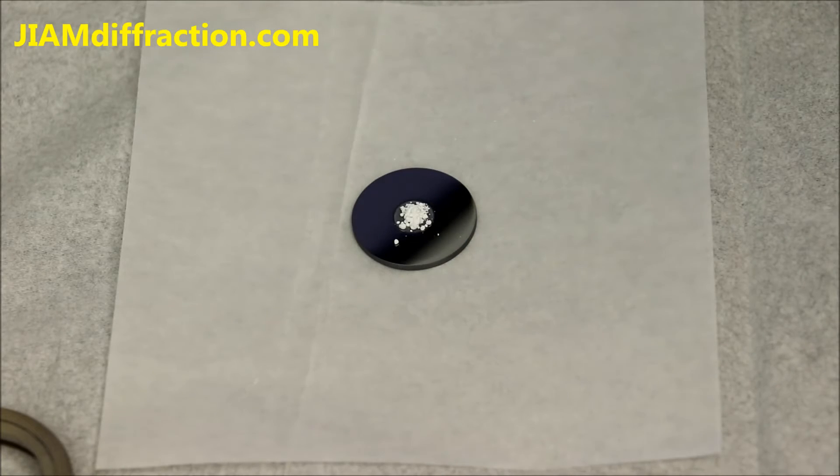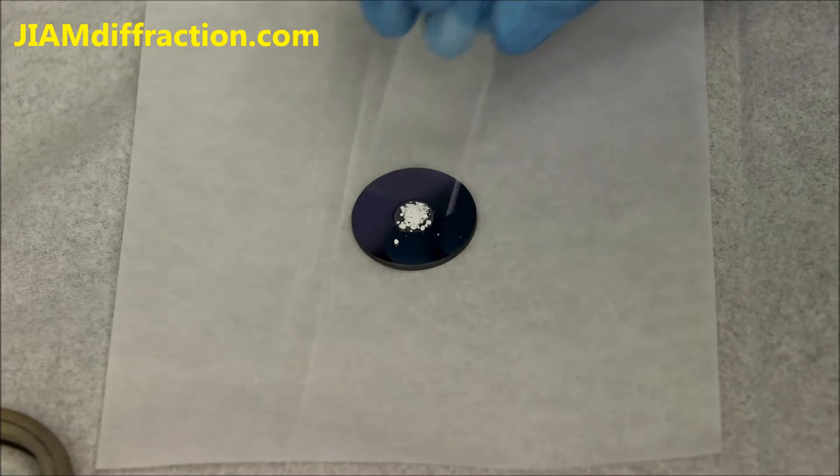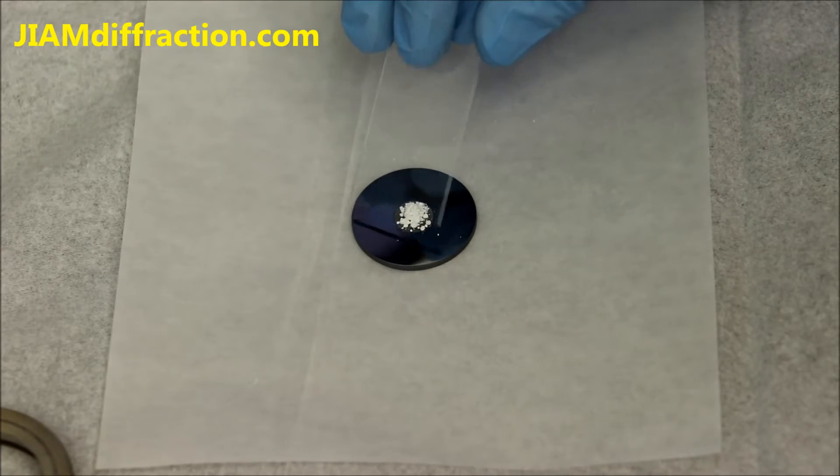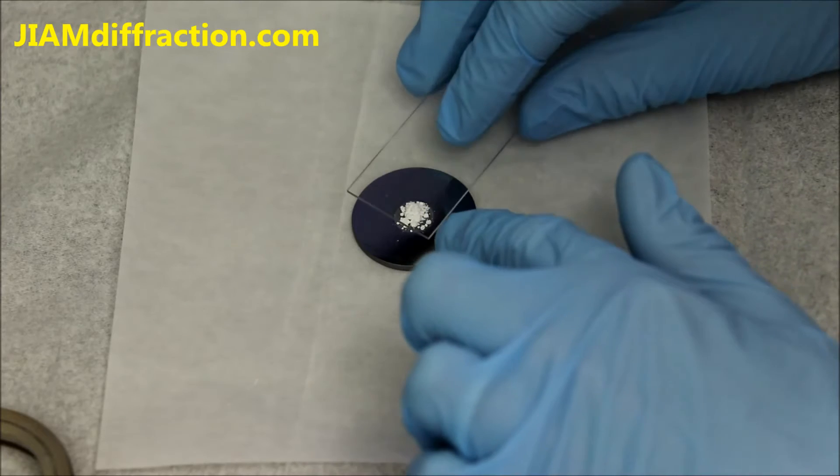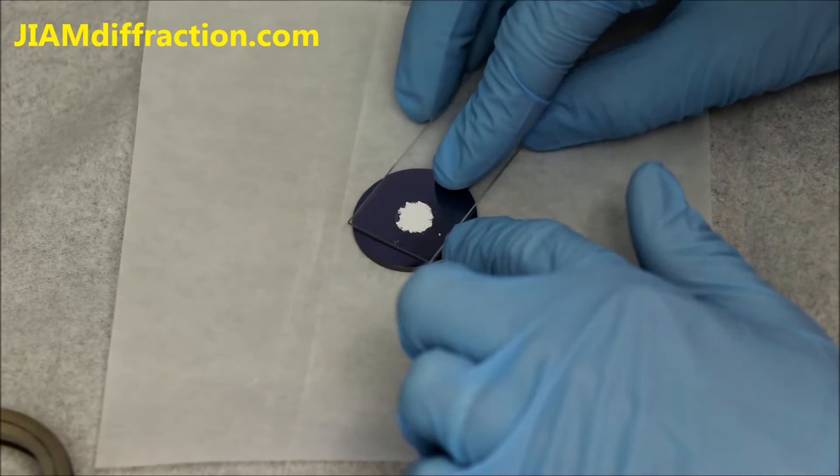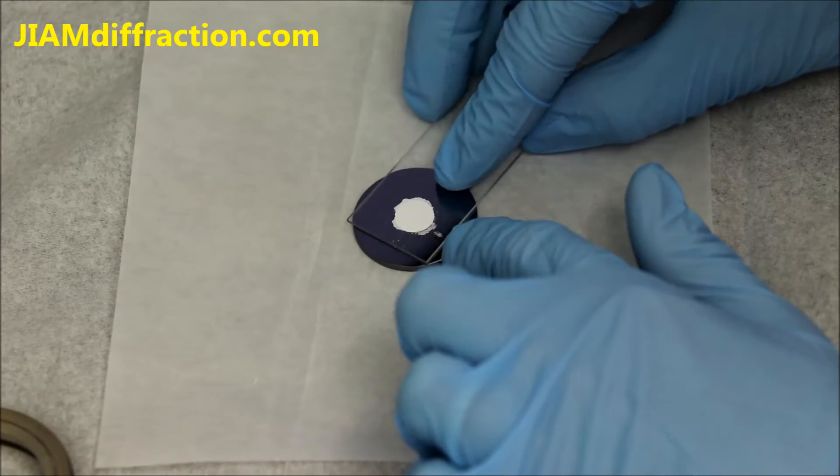That should be plenty. I'll use a glass slide to get that extra powder back in the center. I'll then just press down and wiggle it a little bit just to get it to spread out.